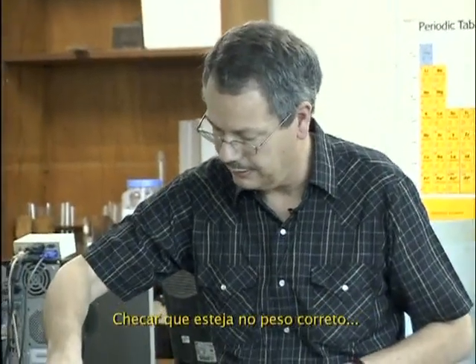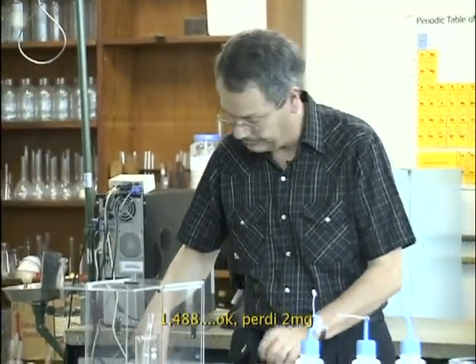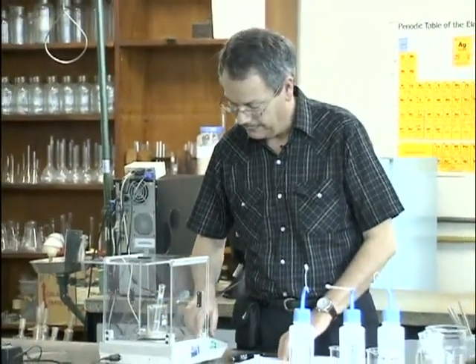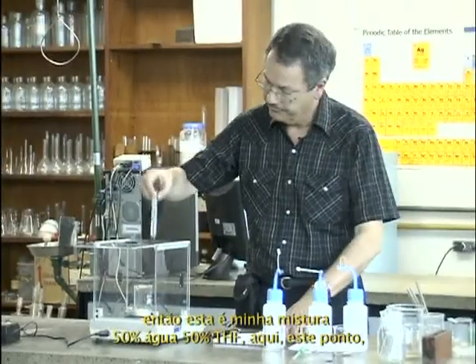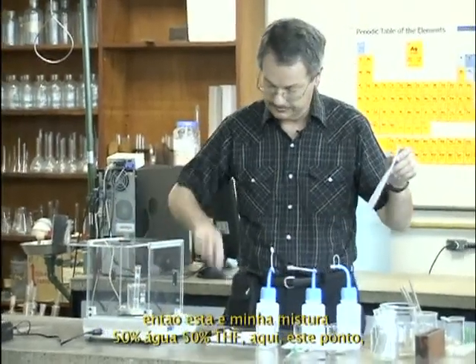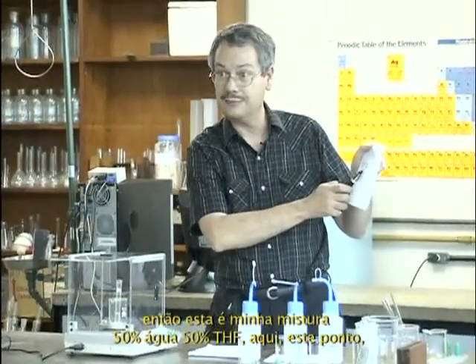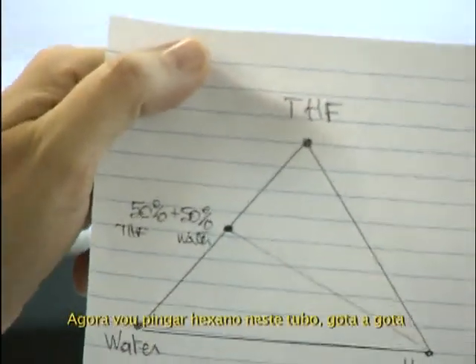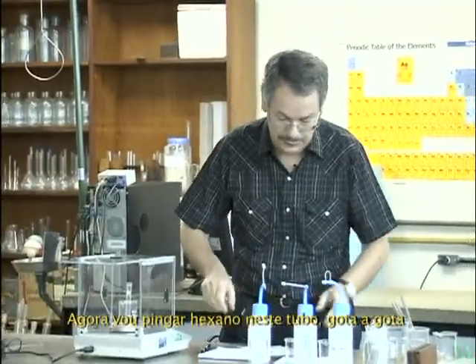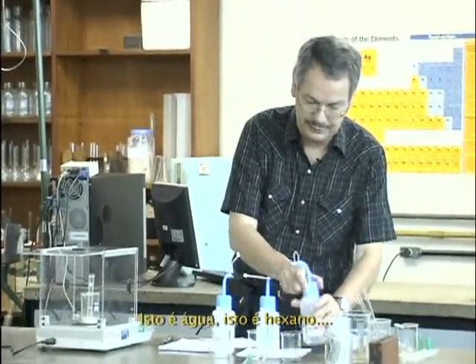Check that this stays at the correct weight. 1488. Okay, I lost 2 milligrams more. I'll put 0 on this. Okay, so that's my mixture: 50% water, 50% THF, at this point. Now I will drop hexane in this test tube, drop by drop. This is water, this is hexane.